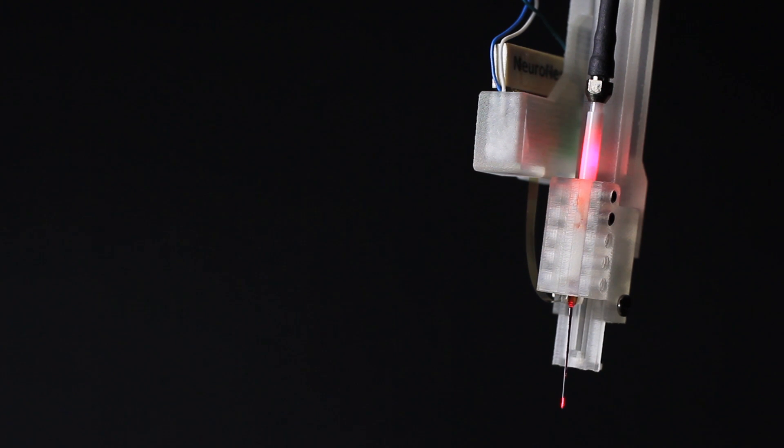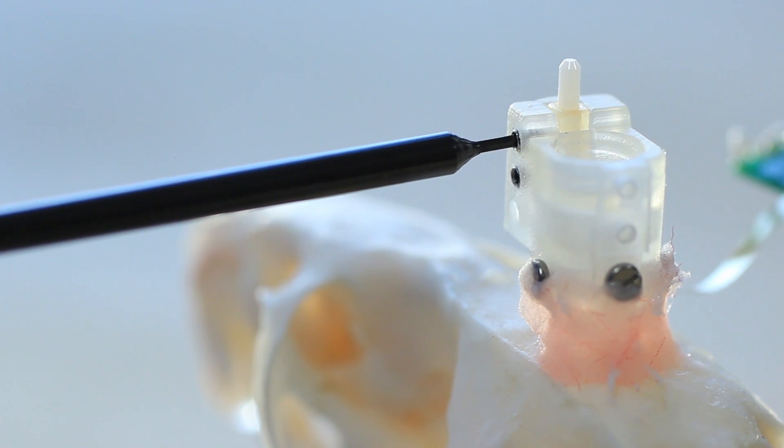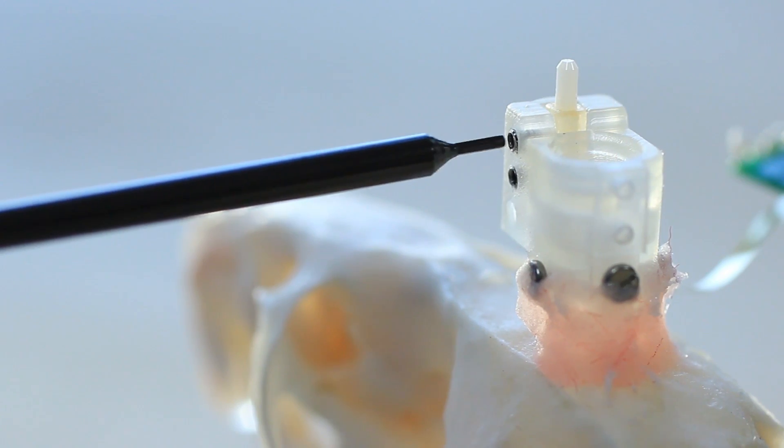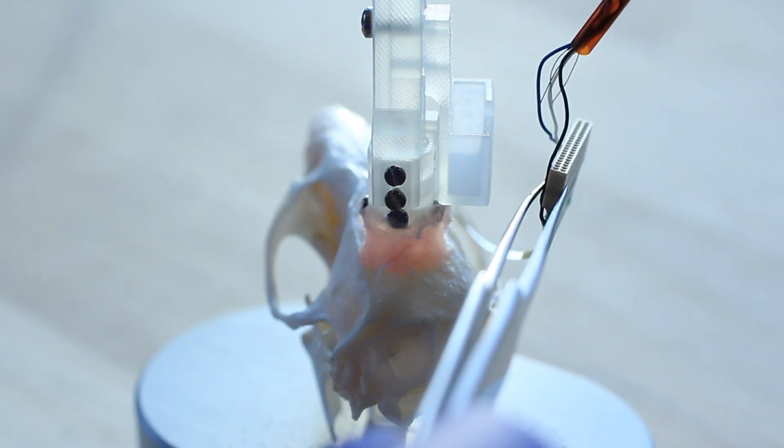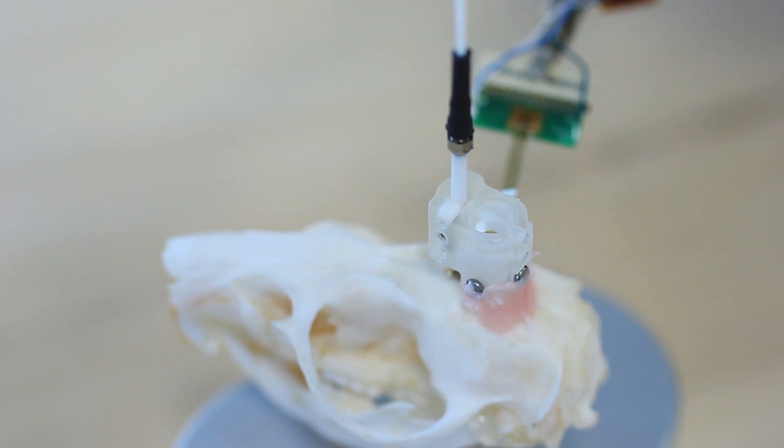As the design of the O-Drive differs slightly from the standard D-Drive, the insertion process has been modified. We will now review the entire insertion process for the O-Drive. Please watch the entire process as the O-Drive may be damaged if handled improperly.